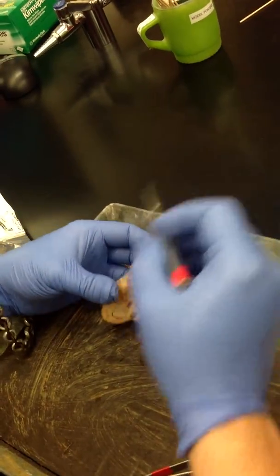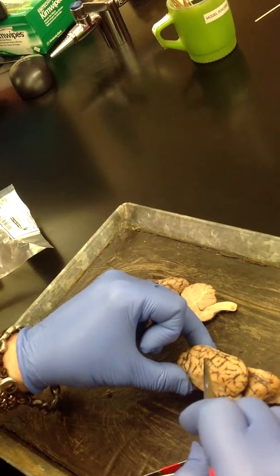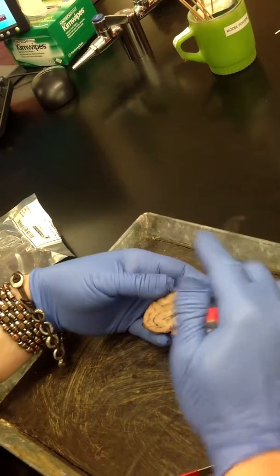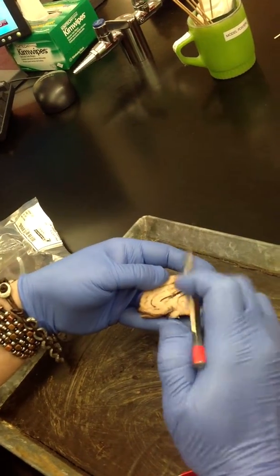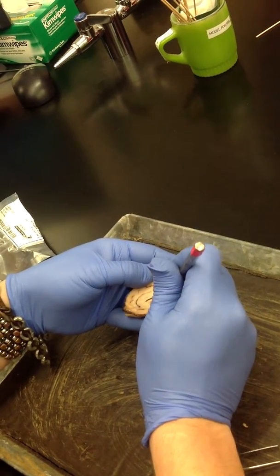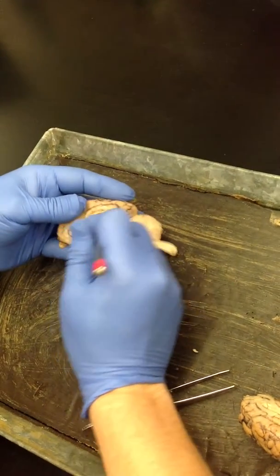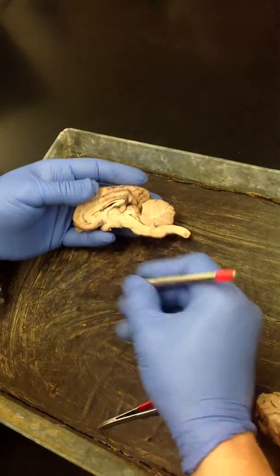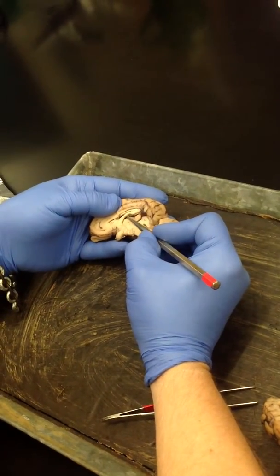So the lateral ventricle is inside of here and inside of here. So you have two lateral ventricles in the cerebrum. To put our probe in there, what I do is I find the corpus callosum, and then I put my probe under the corpus callosum, and I go straight back and then lift up, and I can feel that I'm in a space. That's the lateral ventricle in there. Okay. The third ventricle is right around the thalamus, right there.